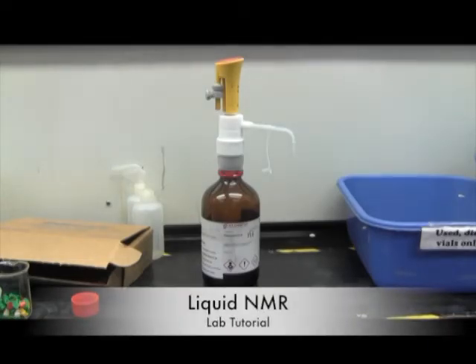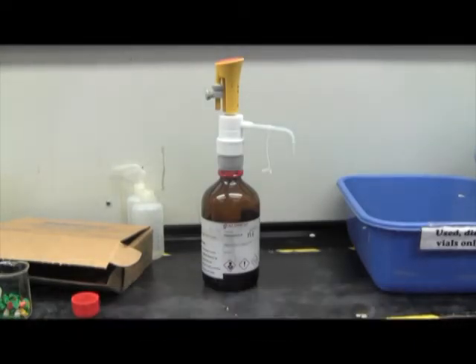In this tutorial, you will learn how to prepare an NMR with a liquid sample. Bring your sample to the waste hood, grab an NMR tube from the beaker, and a clean glass pipette from the box in the waste hood.